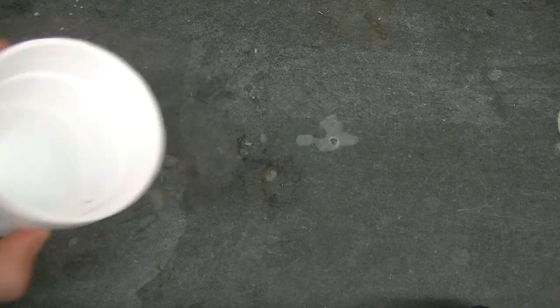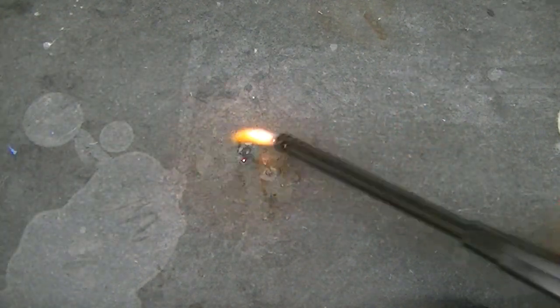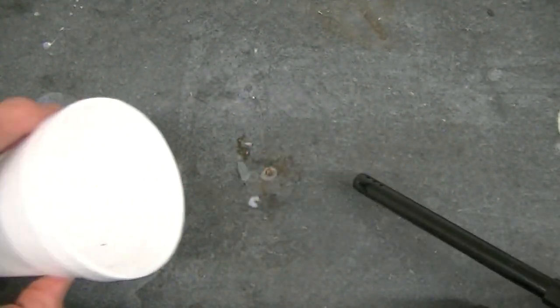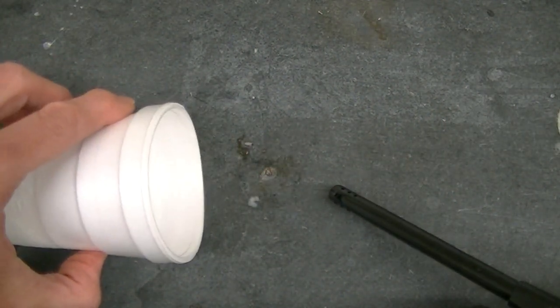I'd also argue that we've gathered some solid evidence that the liquid we obtained in this simple experiment is indeed liquid oxygen extracted from the air.